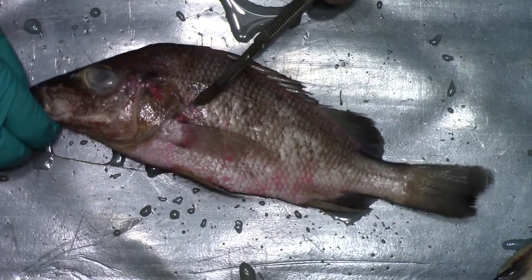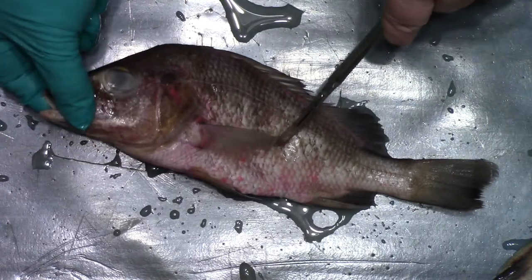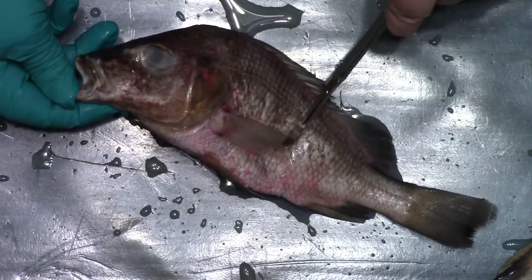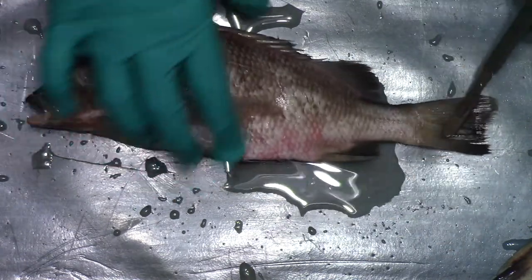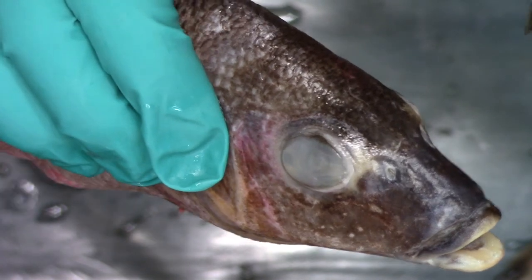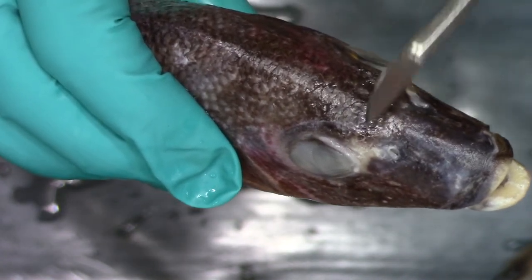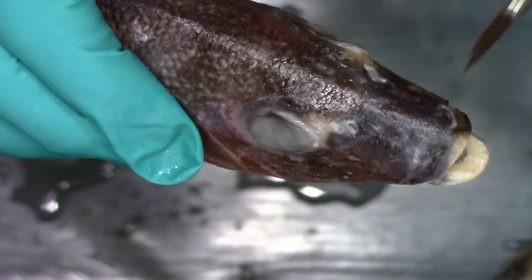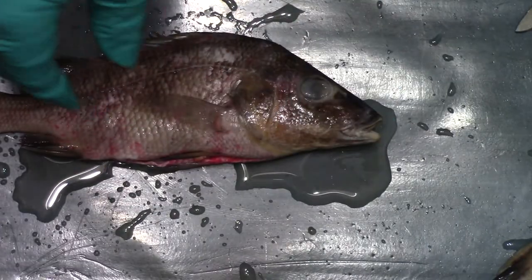You can get in there, and the mouth and jaws sort of pop out as well. I wanted to give you guys a close-up view of the face — you can see the two nares on the top, and the eye and the mouth. That's it for external anatomy.